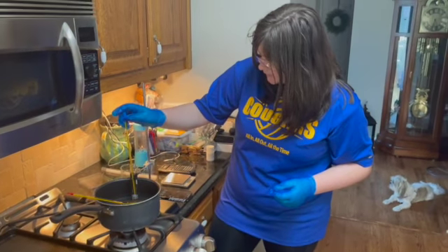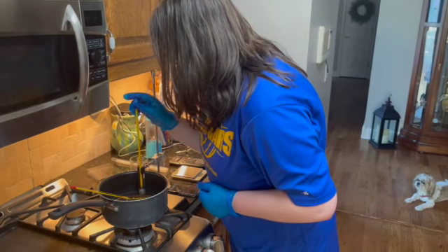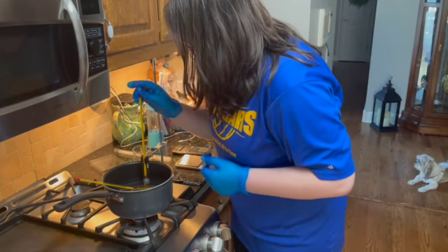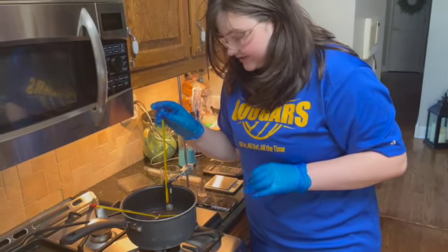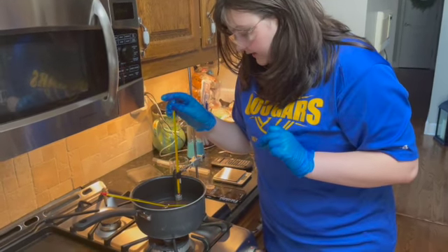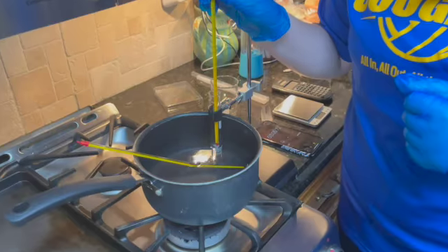And so we just continue. It seems like I am seeing that there is a lot more melting happening right now. It is looking more like a slushy-ish type mixture. There's still a lot of crystallized solid, but it is melting and making it look more slushy-like than it did whenever we first put it in.